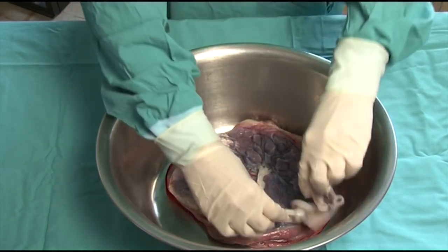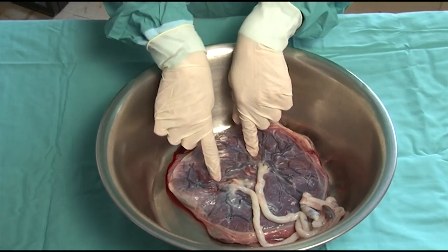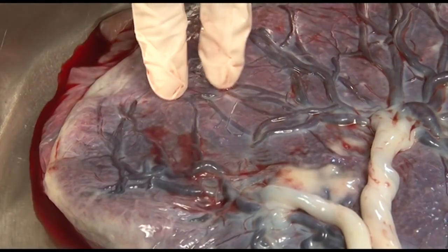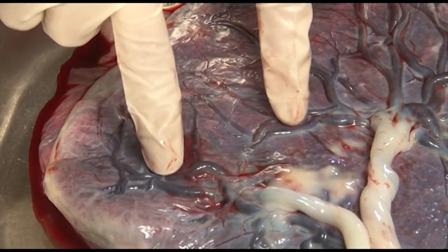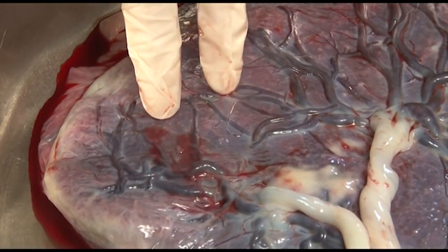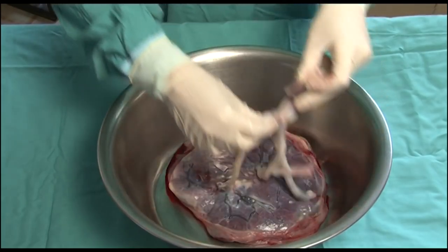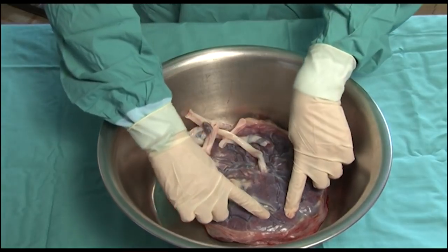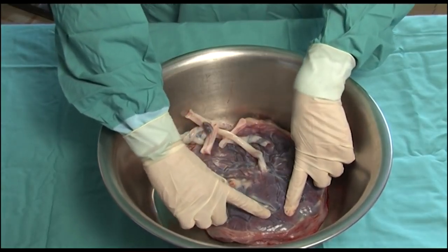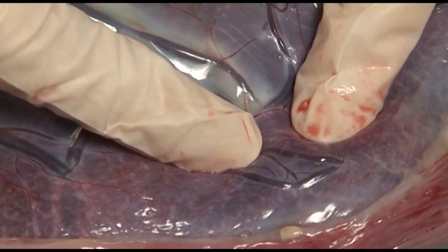When examining the distribution of the arteries and veins as they come from the umbilical insertion points, it is possible to follow the branching until the appearance of anastomoses between the vessels of both cords. These vascular connections can be identified at a number of places. The vessels of both cords derive from different directions, and while spreading through the tissues, they converge and form anastomoses.